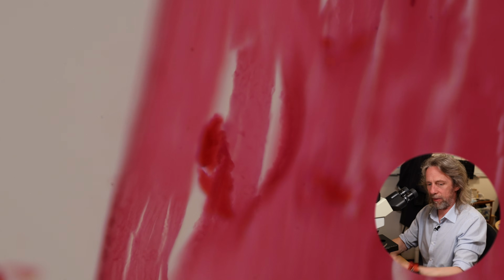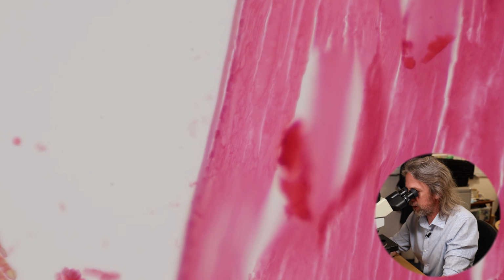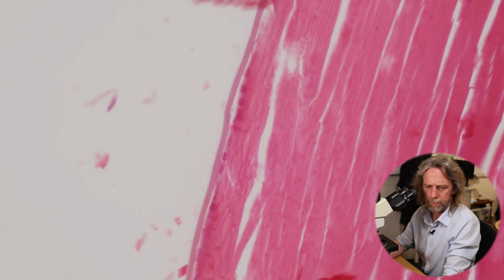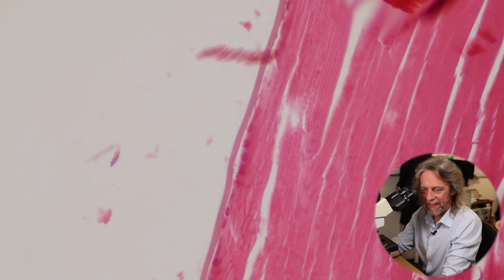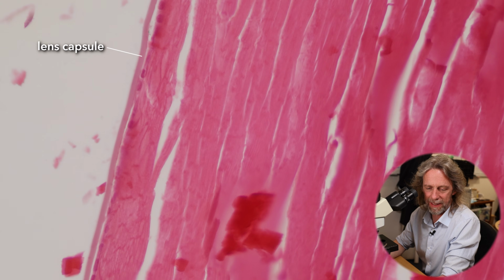Okay, and there's other weirdness. Let's jump up again. So, oh, blimey, just about see. Oh, we can just about see. That's very neat. See if I can find a good bit. What we've got going on here is, can you see? Just about maybe. The lens has a capsule, but it's, so you can see the capsule on the lens there, right?